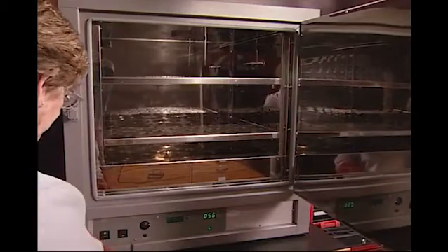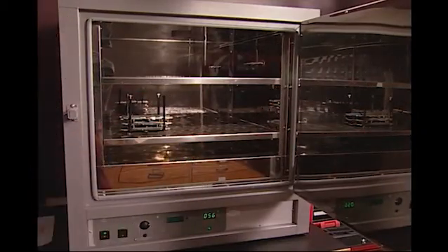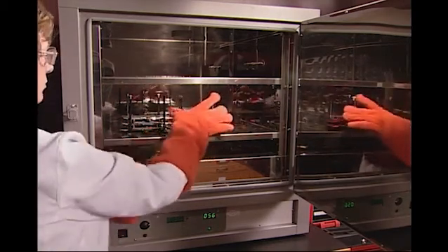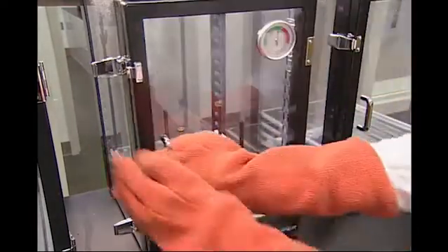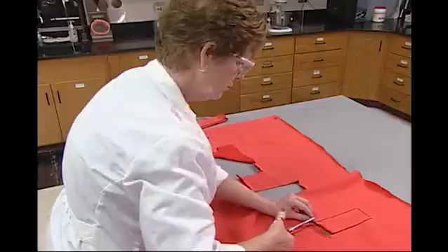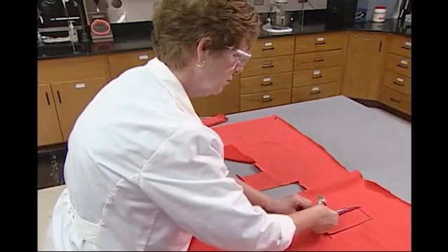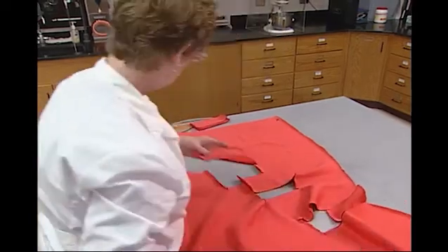The specimens are mounted in testing holders, then exposed in a circulating air laboratory oven at 105 degrees plus or minus 3 degrees centigrade for 30 minutes. Then they're placed in a desiccator that allows cooling but no change in moisture content of the fabric specimen. Once the direction of the fabric specimen that burns the fastest is determined, five additional specimens are cut from the laboratory sample.